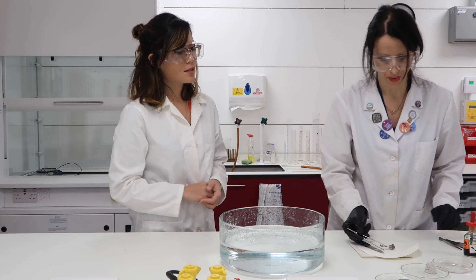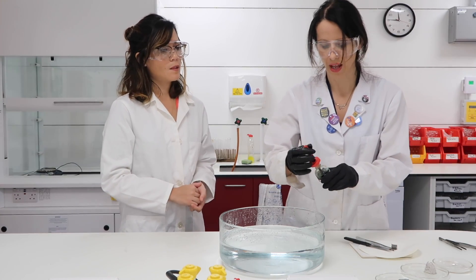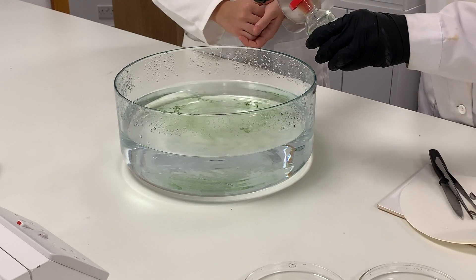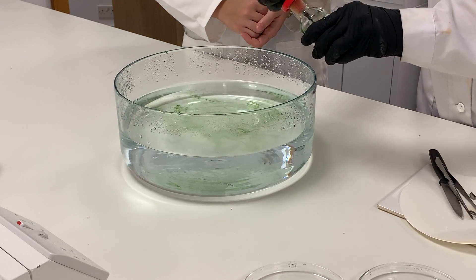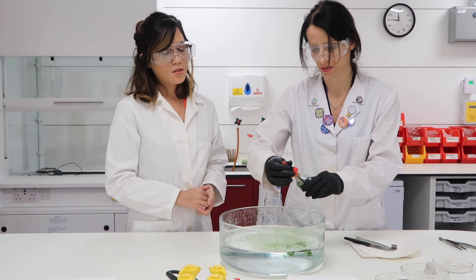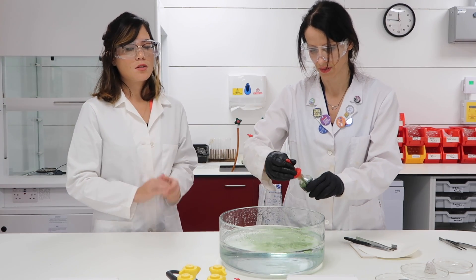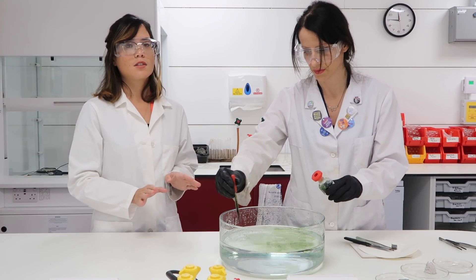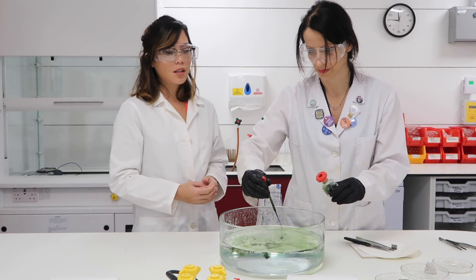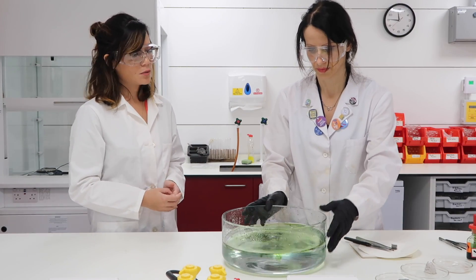Look how small that piece is. I'll put some drops of Universal Indicator because we want to see the change in colour. Remember, Universal Indicator shows you a change in pH, so depending on the colour it turns, we'll know if our solution is acidic or alkaline. It's gone green because water is neutral.